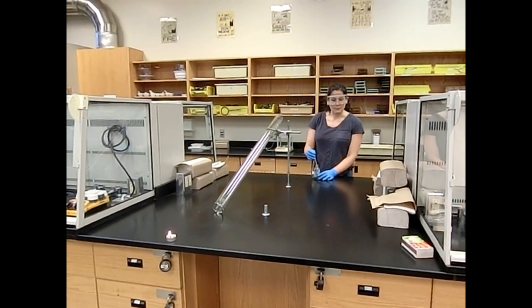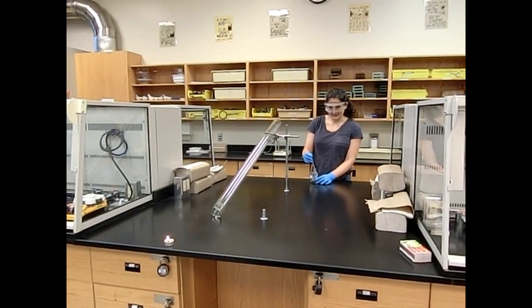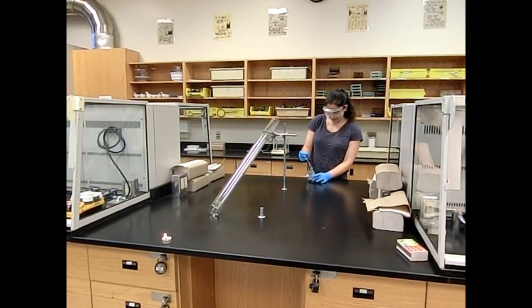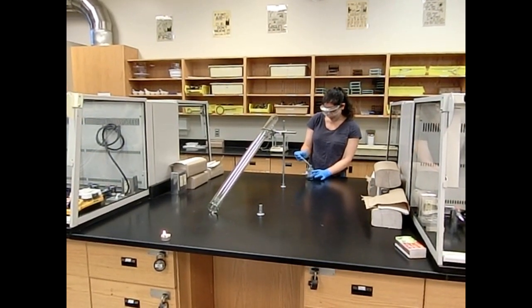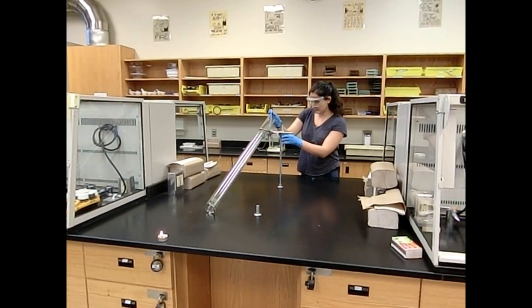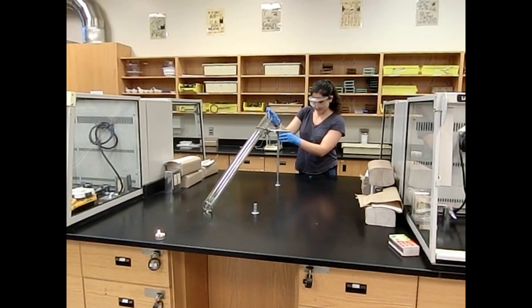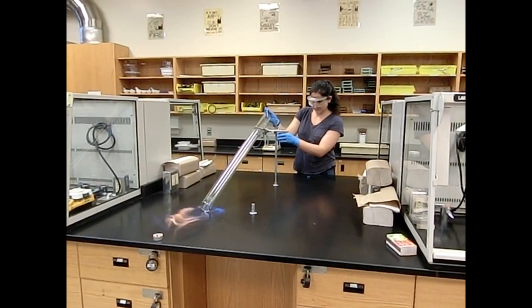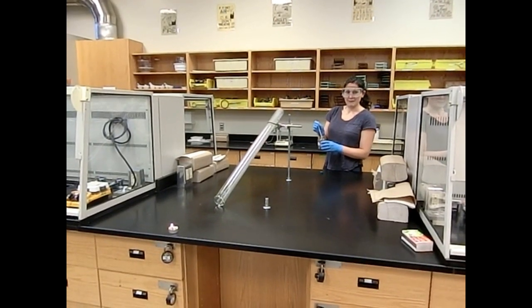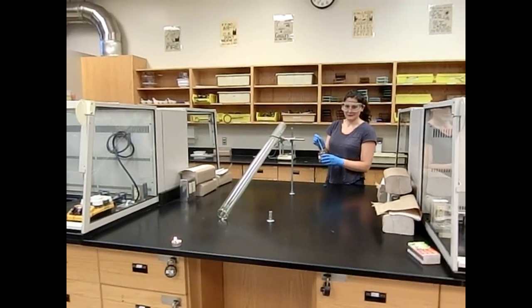Jim wasn't kidding when he said the open flame and ether don't mix. Here's a little demo, and you can see I'm all the way on the other side of the bench from that open flame with my ether. Okay, I'm very happy to be all the way on the other side of the bench from it now.